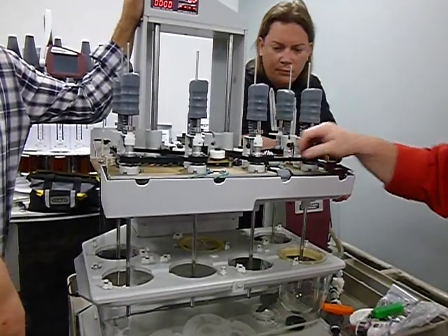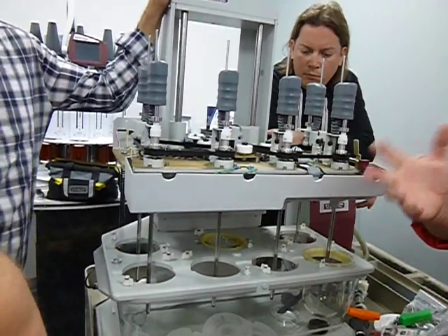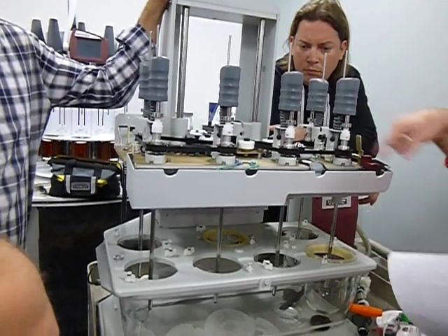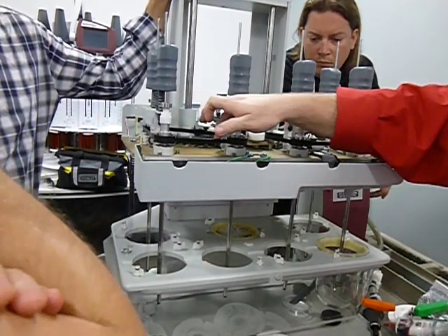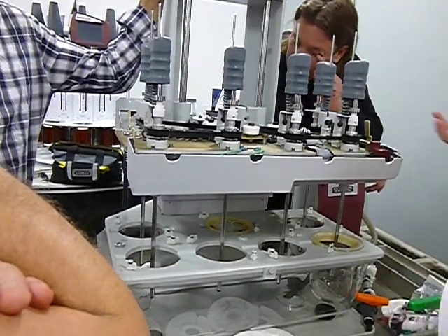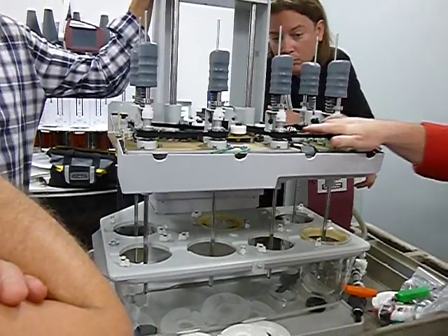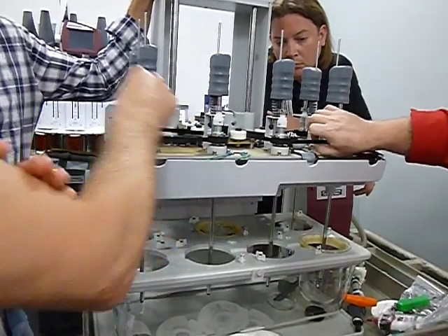What you're really looking for is, again, each one of the teeth on the back of this thing should be rectangular. Over time, as they go around, they tend to get rounded. You can feel it. You can feel if it's nice and still sharp up on top here. I can feel it with my fingers. If there's a good ridge on there, the belt's still got some good wear on it. You can still continue to use it. If it's really getting smooth up on top and on the bottom of the teeth, it's getting worn. It needs to be replaced.